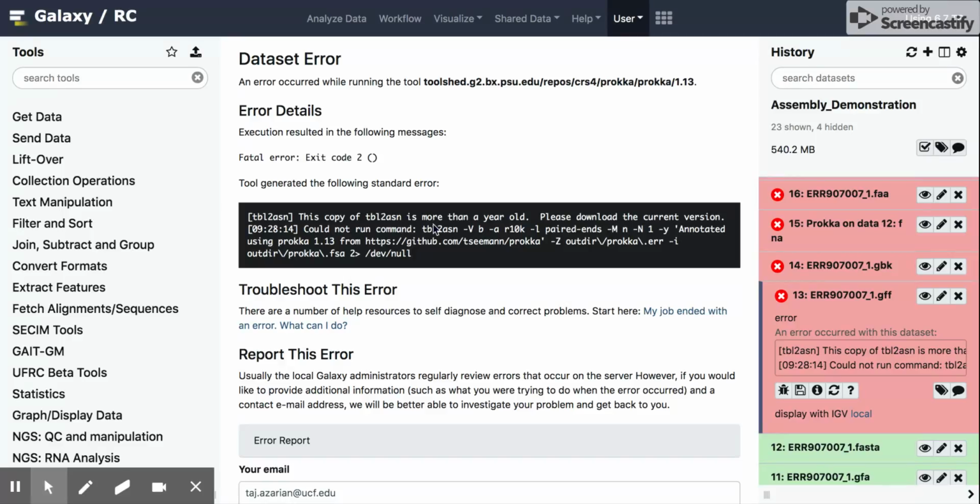This is actually a comedically common problem with Prokka because it uses this NCBI tool that likes to expire every year. So everyone has to update their installation of this program on an annual basis, and it just happens that we ran into that experience here and could use it as an example of how to restart the analysis.